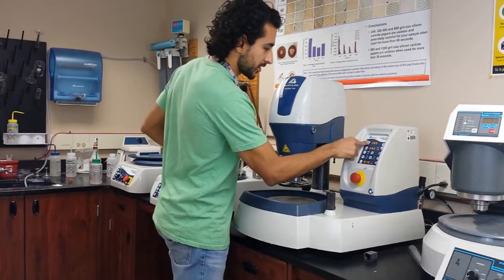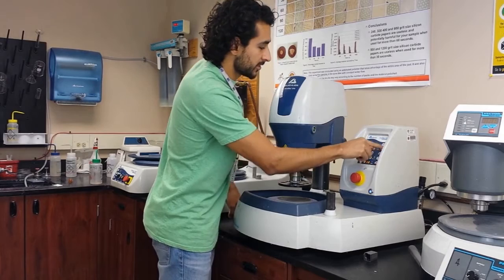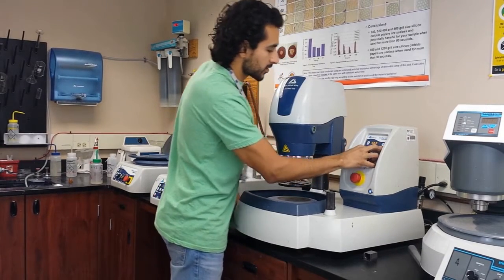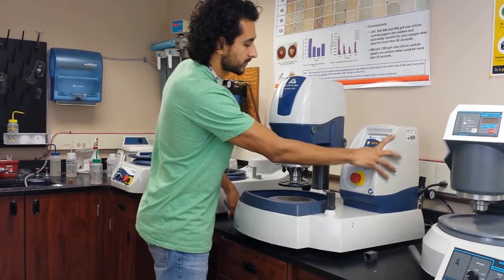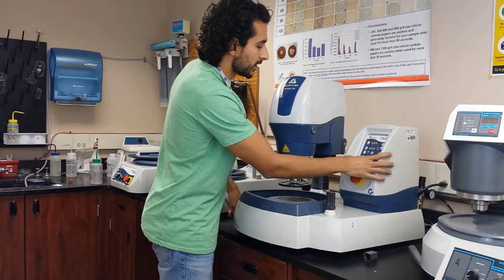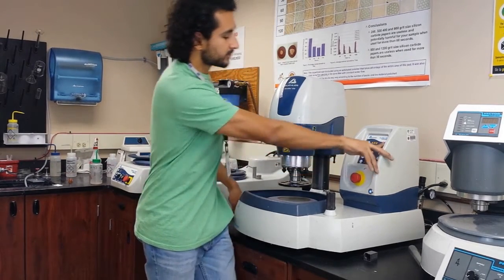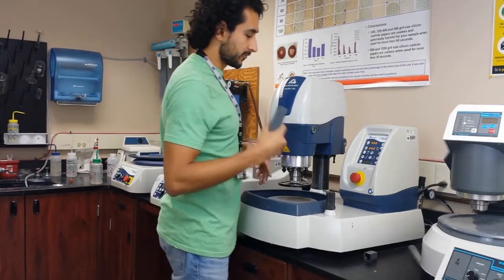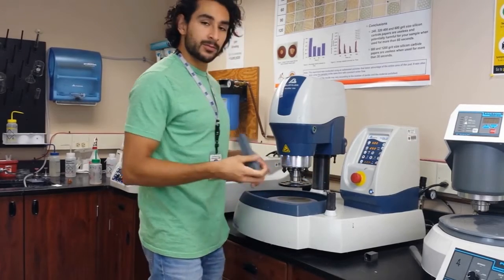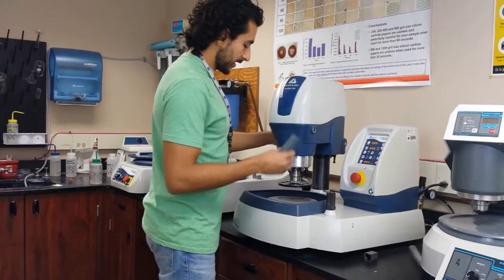The settings change — I'm going to run this for five minutes. The speed will be a little slower, I'll stay at 250. For the force, I want it to be a little less — I'm going to stay at five pounds of force. Before, for every silicon carbide step, we were using 10 pounds. So I'm going to take it down to five pounds. Let's sharpen the diamonds.